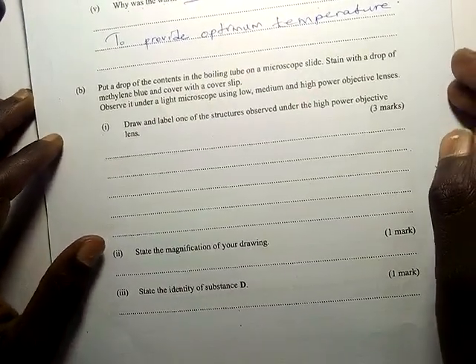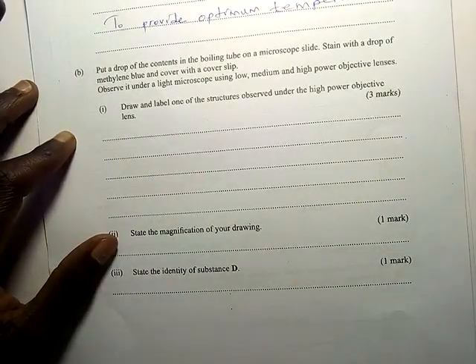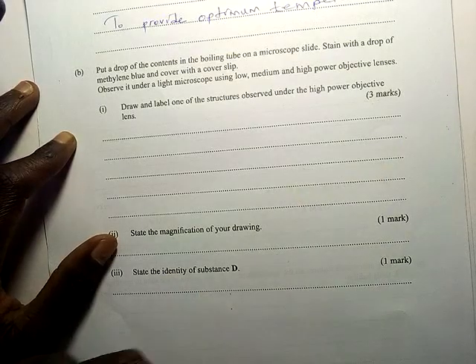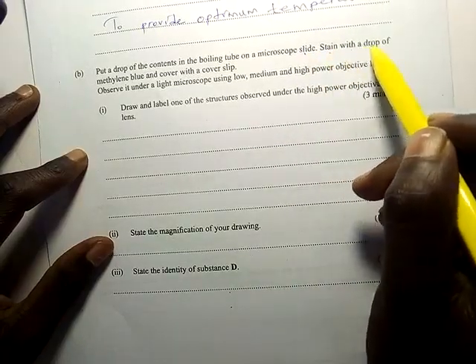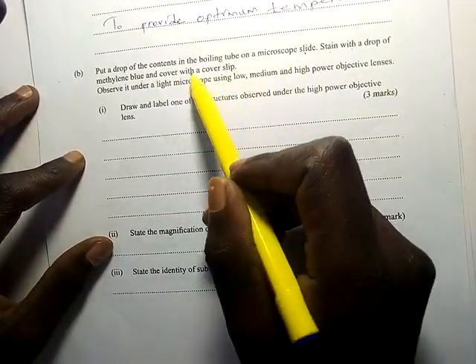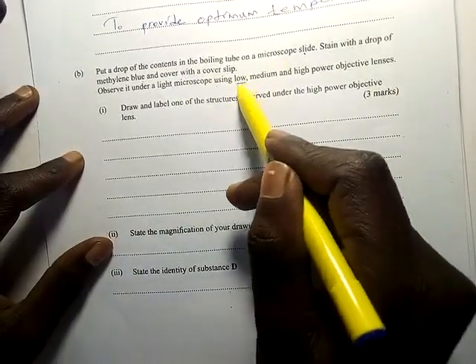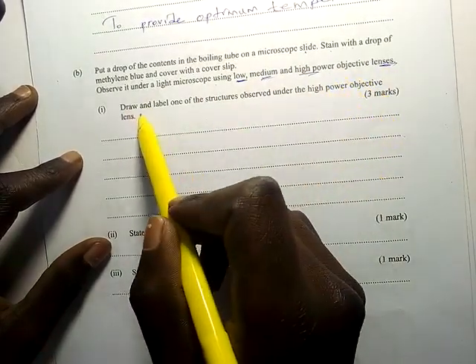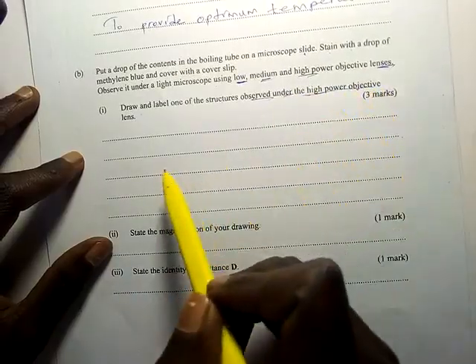In part B, put a drop of the content from the boiling tube onto a microscope slide. They provided a microscope. Stain it with a drop of methylene blue and cover with the cover slip. Observe under the light microscope using the low, medium, and high power objective lenses. Draw and label one of the structures observed under the high power objective lens.